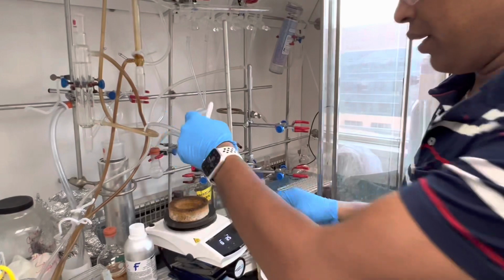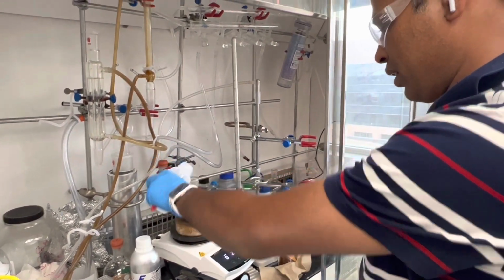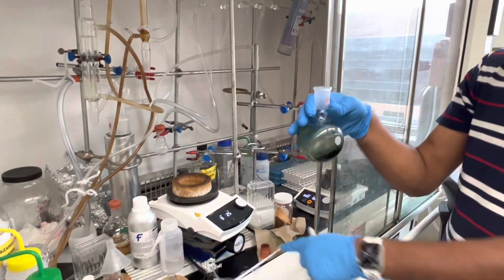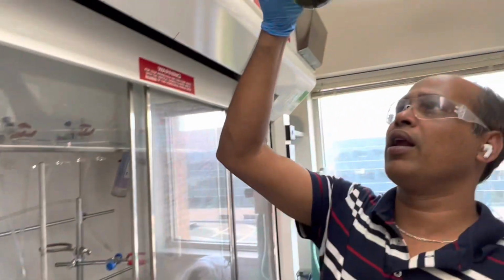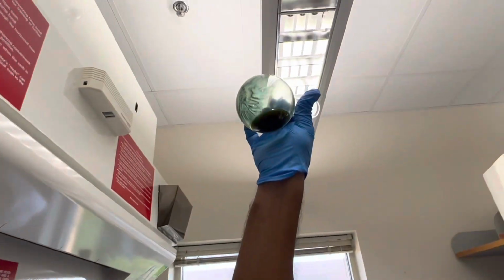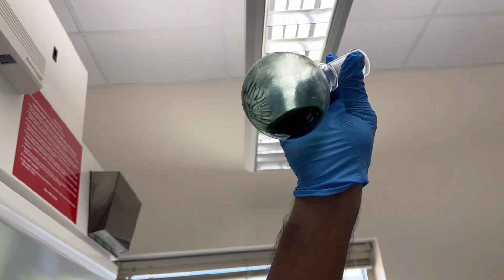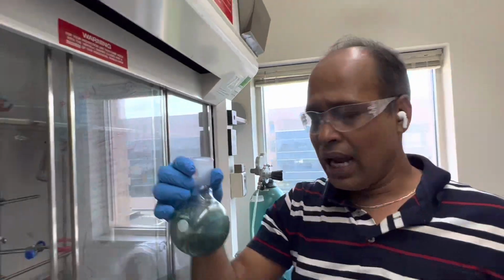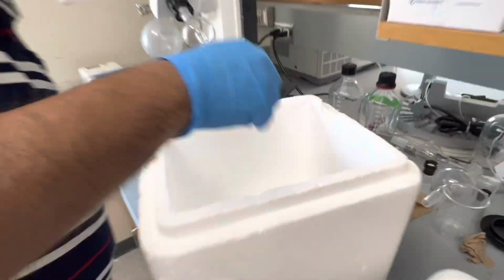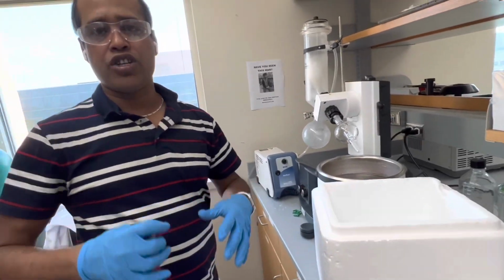You can do one more thing. You don't need to hurry or rush. Just add a little bit, and keep it so that the ether is cooler than room temperature. In that case, you can clearly see some solid here. Is it visible? Yeah, so you see the solid forming. I would put it in the cooling system for a little more time and try to scratch it with the solvent. That is called trituration.